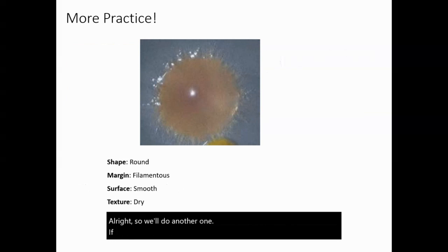So if you look at this one, its shape is round because if you trace the outside of it, and I'm not going to be very good tracing it with my mouse, it's round. Pretty darn close. However, when we're looking at the margin, just the edge, notice it radiates straight out.